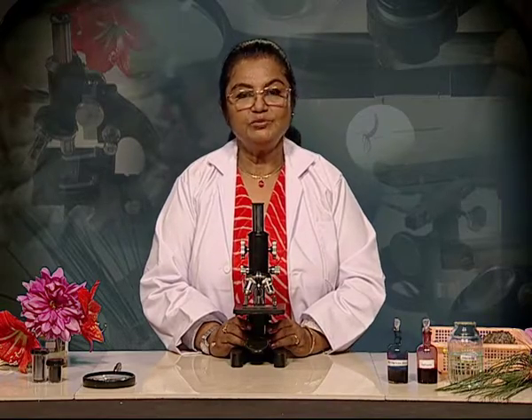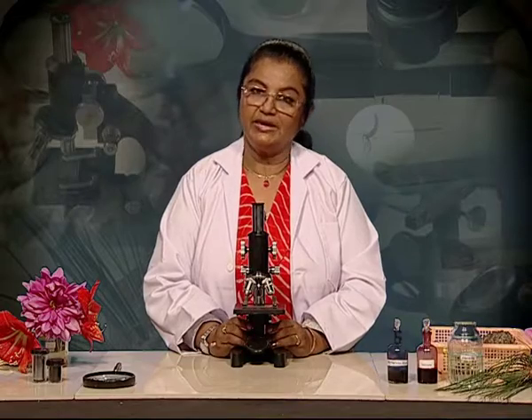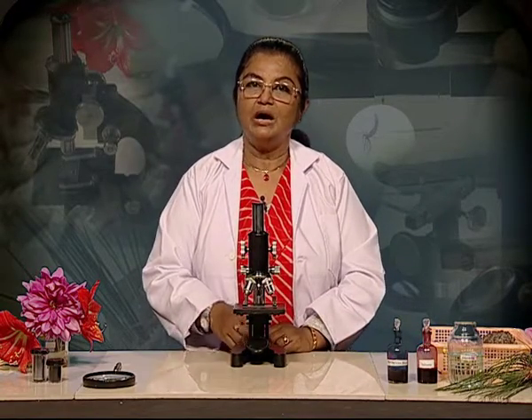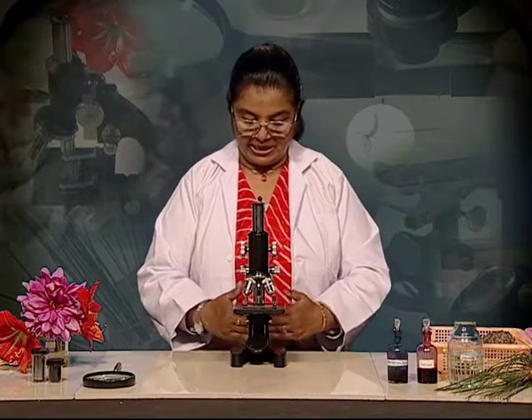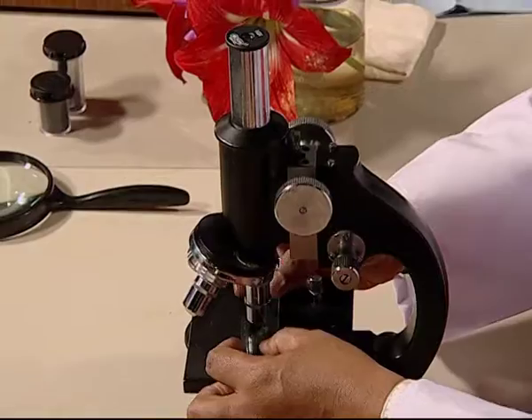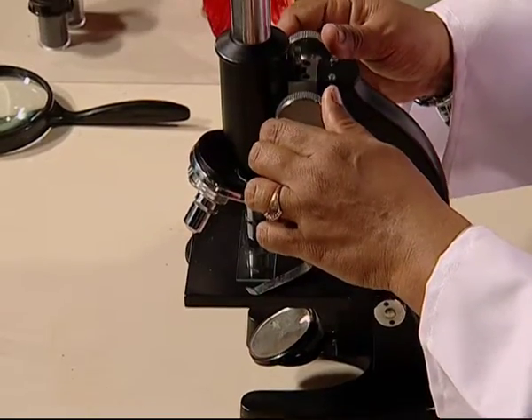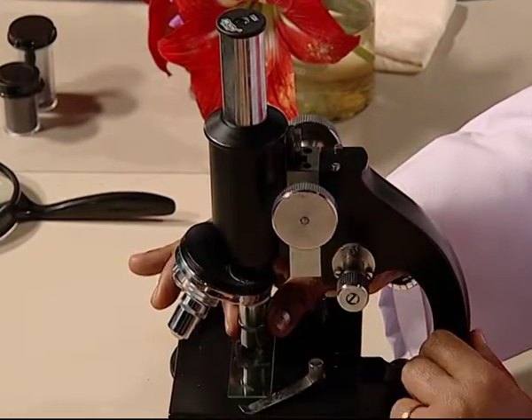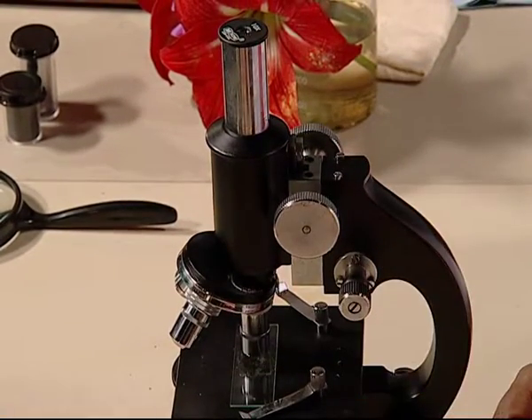A compound microscope is a very expensive instrument that is used in a lab. So, we have to take utmost care of a compound microscope while using it or while storing it. First and foremost, you should place the microscope with its arm facing yourself and 15 centimeters away from the edge of the table to prevent its accidental fall. When your slide is set at high power objective lens, never use the coarse focus knob, because the lens can get damaged or the slide may break if you ram the lens into the slide.